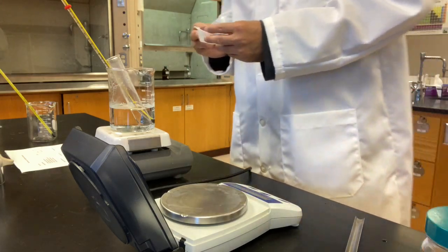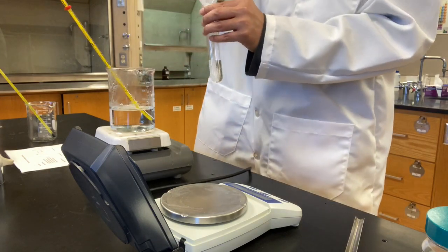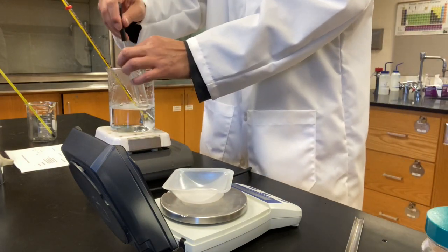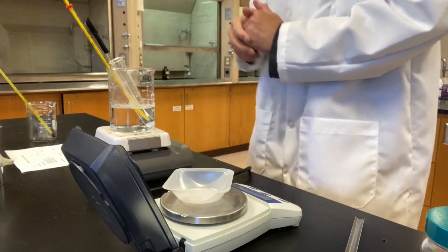The last one is 2.173. This one is 2.244. Let's give it some time again.